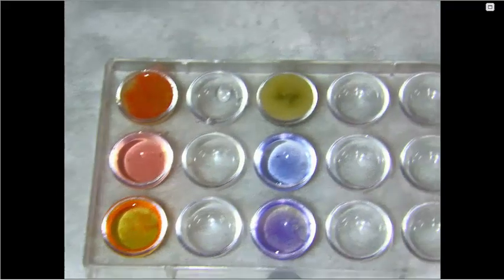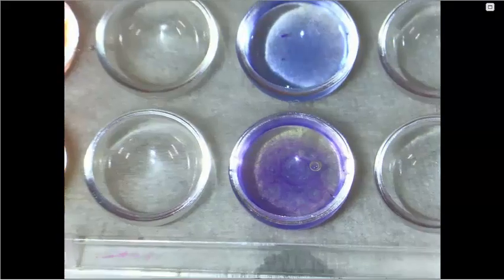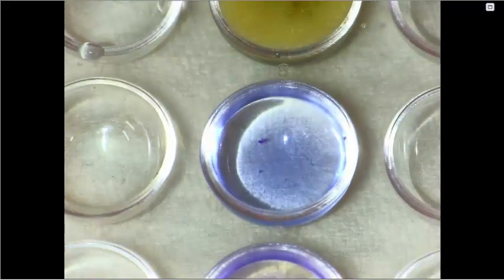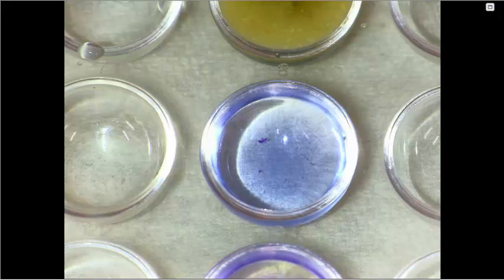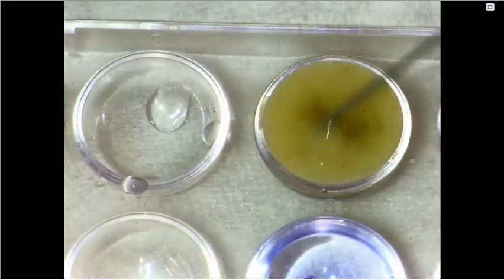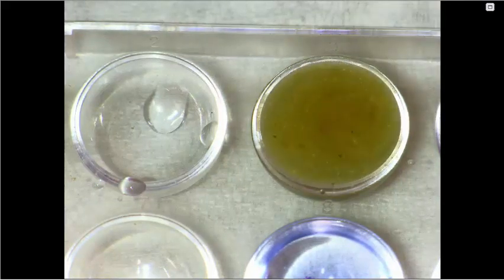And we'll make some careful observations here. Let's zoom in. In the egg white solution, we can see that it turned a purple color. In the water, it stayed blue. In the McMush solution, we're not seeing a big color change happen. If I give this a little bit of a stir, I'd say that's not purple. It looks a little bit greenish, but I would not say that this is a positive result for the protein.